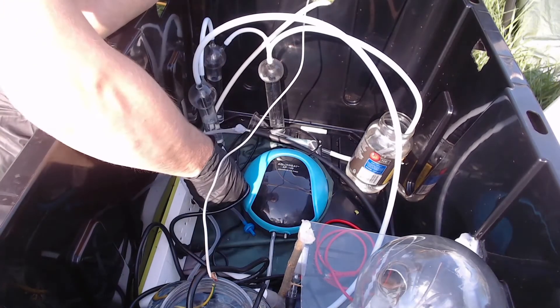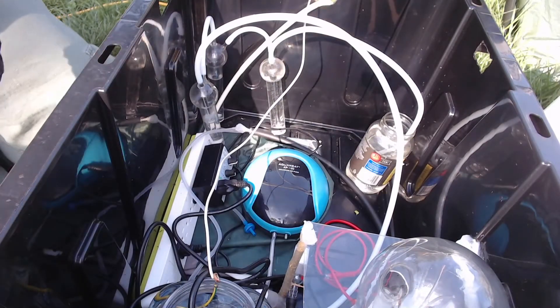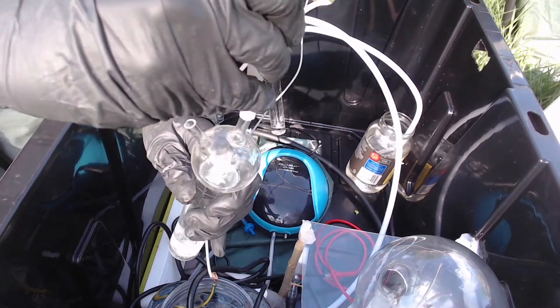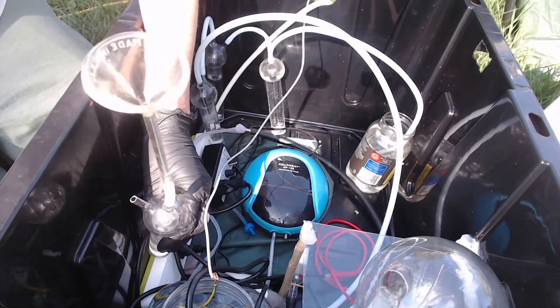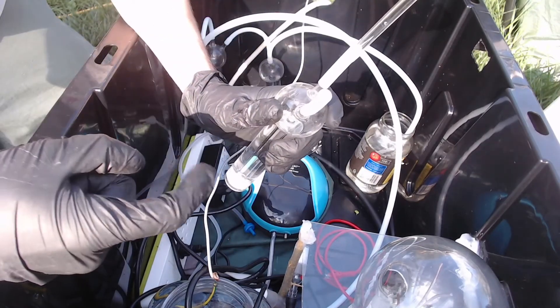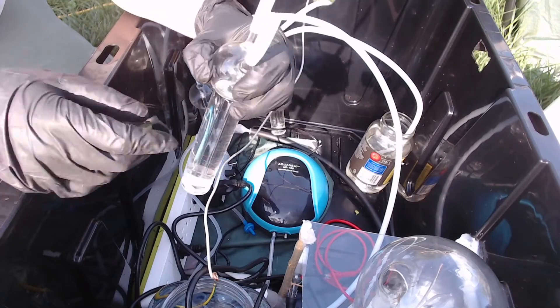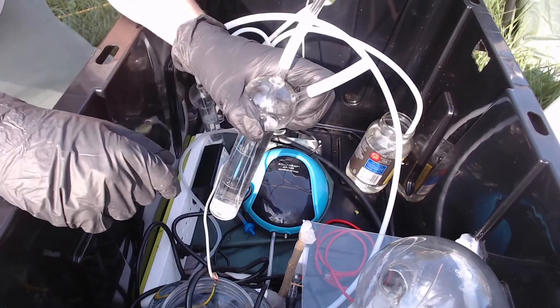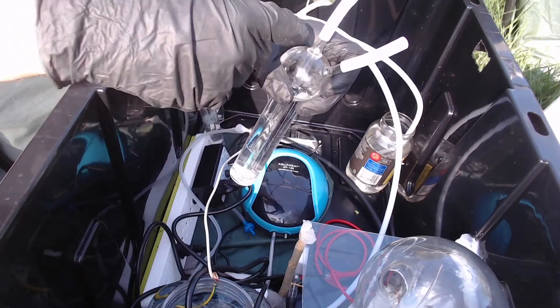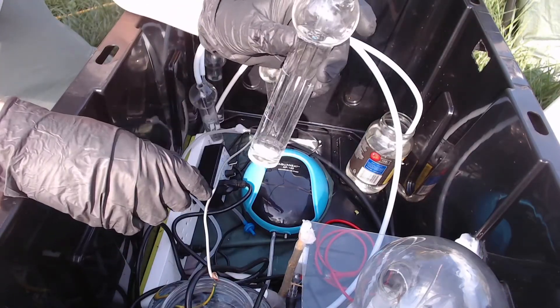The duty cycle timer is pretty simple. I made up a couple of these refilling setups for the scrubber bottles because it's kind of a pain otherwise. I slide a funnel on the top to let water come in, and then there's a fitting for a little hand vacuum pump so I can draw a slight vacuum and pull the water down through to fill them up. Just trying to pour it in through the side doesn't really work — there are flow issues where the water will just start back-flowing up the center tube. Maybe I'm supposed to fill it inverted; I'm not sure. I've never actually used these scrubbing bottles before.